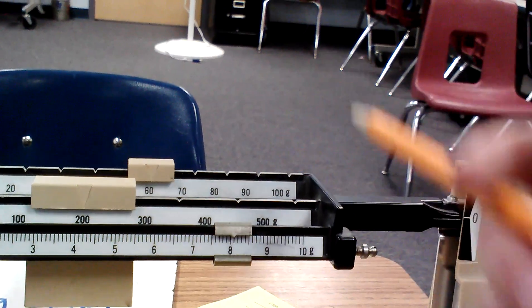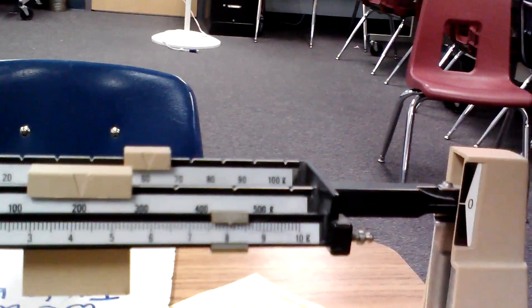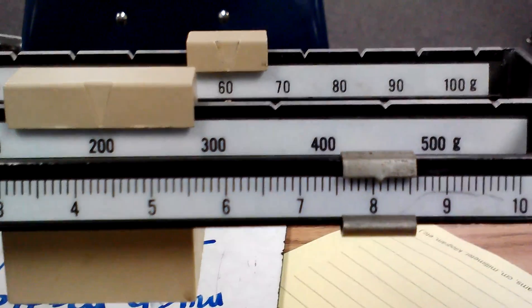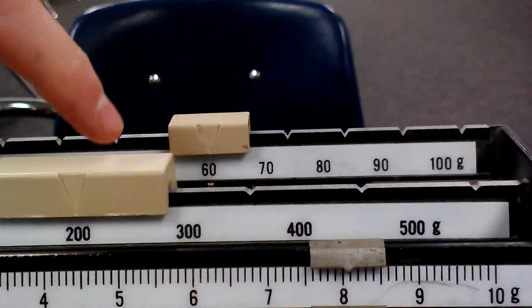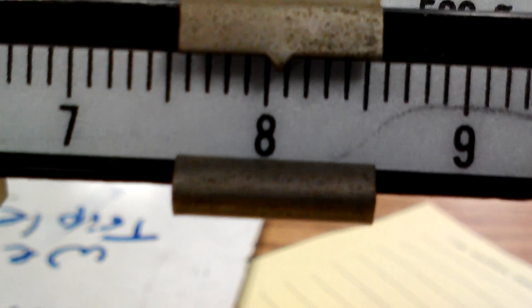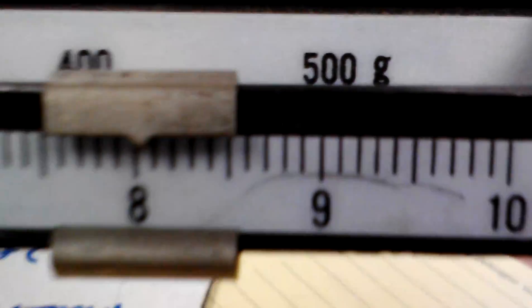So, it's going to be about 268 grams. 268, yep. So, how you add it up is you start, and you see the 200, and you go over to the 60, and then you see 8. But if it's between the 8 and the 9, you would do... Actually, I think it's 268.1 grams.